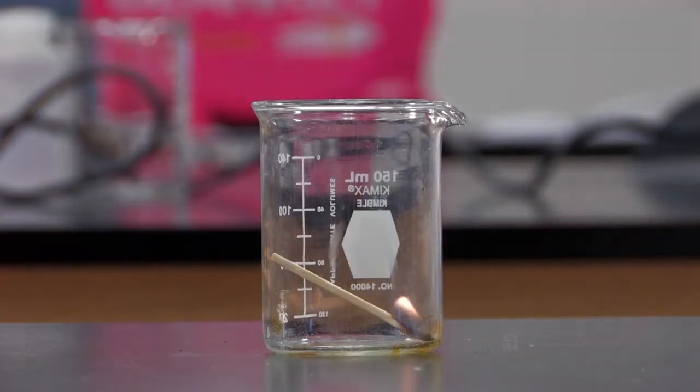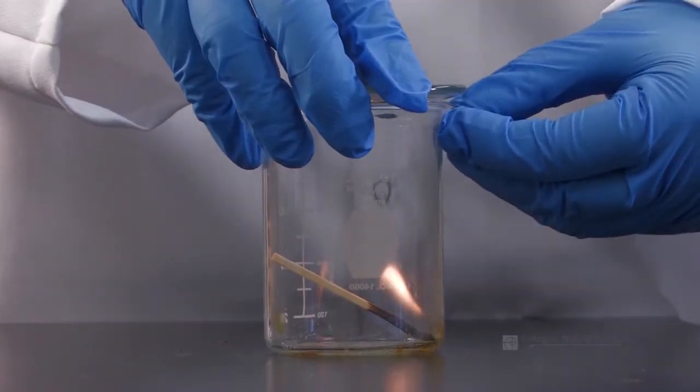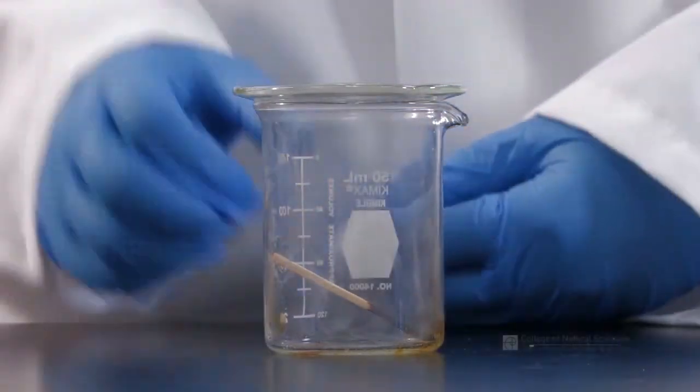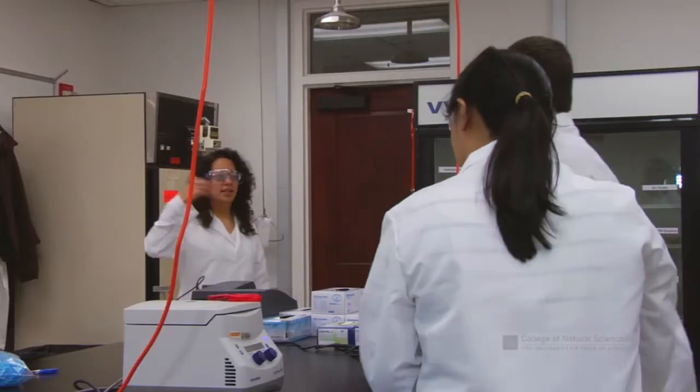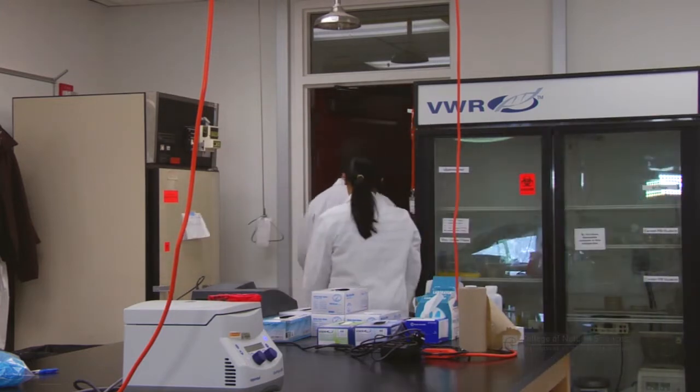If the fire is contained in a glass vessel, like a beaker, then it may be extinguished by simply placing a watch glass on top of the opening to suffocate the fire. Fire extinguishers are not designed for large, expanded fire, but rather to control a small fire at the very beginning of the incident. Evacuate the area if the fire cannot be extinguished, or if you do not feel capable to do so.